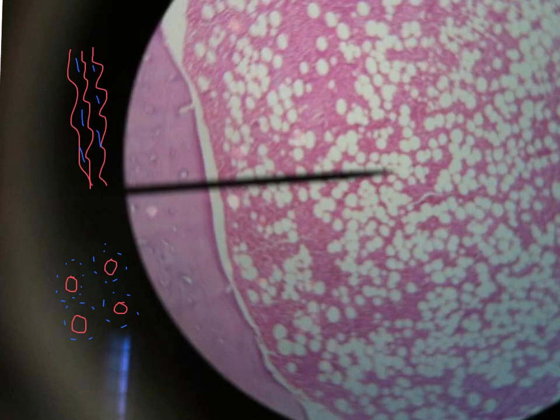This is completely different from the wall of the aorta, which was characterized by the presence of the wavy red elastic fibers, and in between them we have the nuclei of the smooth muscle fibers. Also, in the lumen of the aorta I don't see a bone marrow at all, while in the lumen of the decalcified compact bone, I will notice the bone marrow.